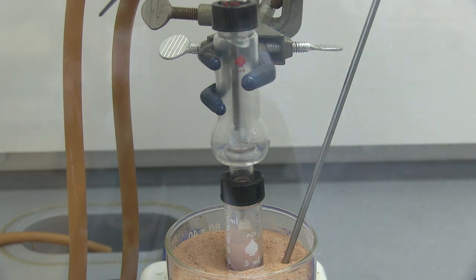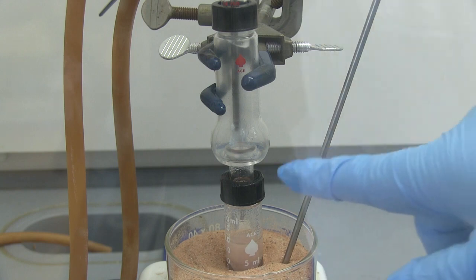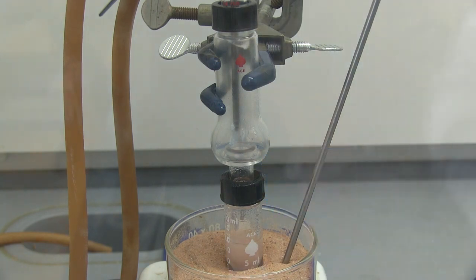Right now we have a really quick rise, as you saw, it bubbled really fast there. We're at 109.6 on the temperature, turning the heat off on the heating plate. We may need to raise it if it goes too much higher, but we're about 38 degrees Celsius on the vapor temperature. And as you can see, we are collecting liquid in here, and we'll see if we get enough. Temperature's starting to go back down again.